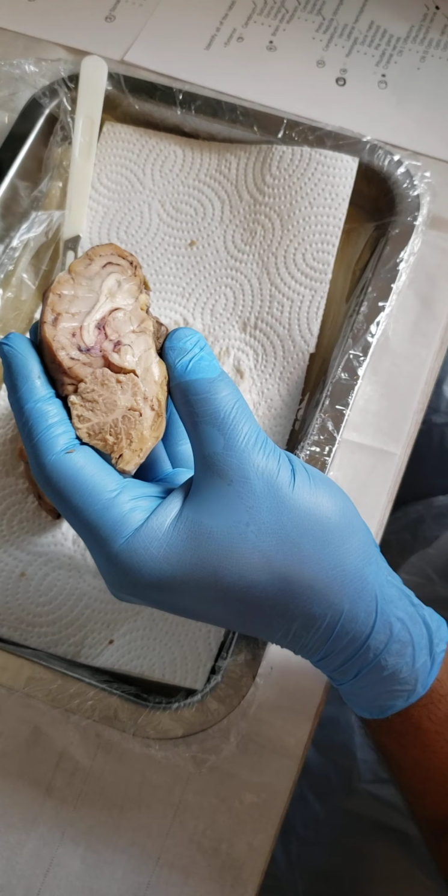Next, we have our meninges. It's actually pretty hard to tell, but first we've got the dura mater, which would be on the outside. Then you have the arachnoid, and then I believe the last is the pia mater, which is this section that you can see right here, that glossy casing. So I believe that's the pia mater, then the arachnoid, and then the dura mater would be on top of that. Pretty difficult to see those right here.